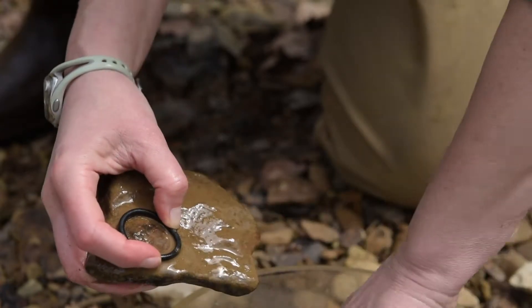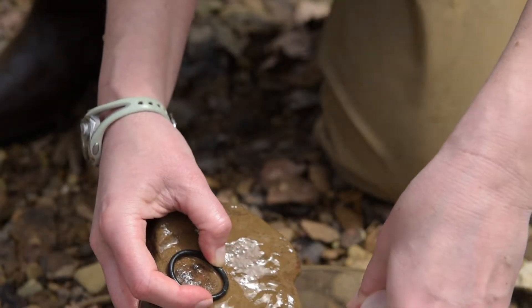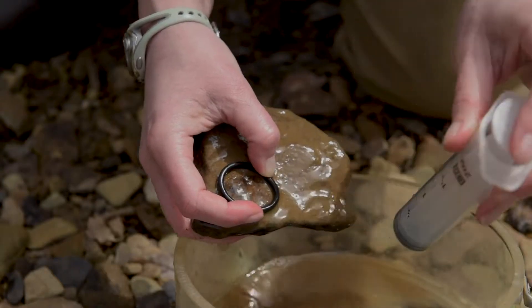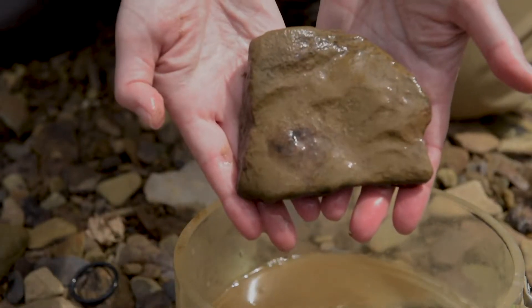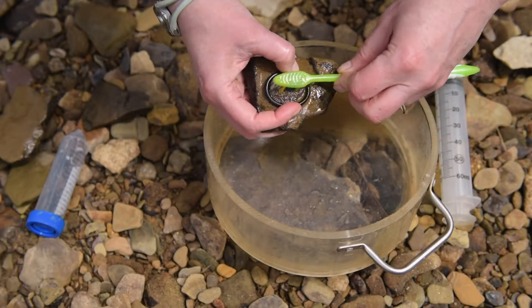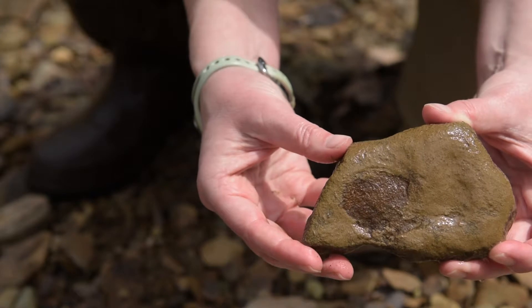If we want to quantify the diversity of diatoms on the rock, we will need this measurement of area scrubbed. Rinse with the stream water and repeat. Once you are finished with a rock, it is usually obvious where you've scrubbed. An o-ring is perfect for this work because it is flexible. Even if you pinch it into an oval to fit on the rock, the area will stay the same.